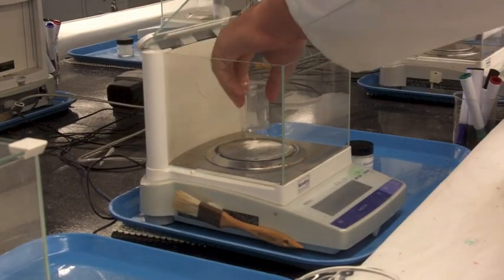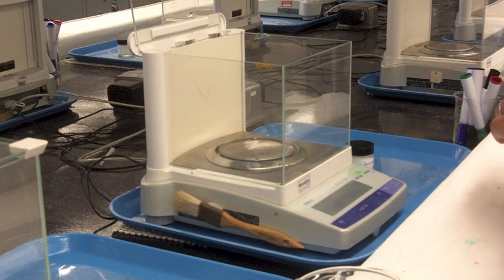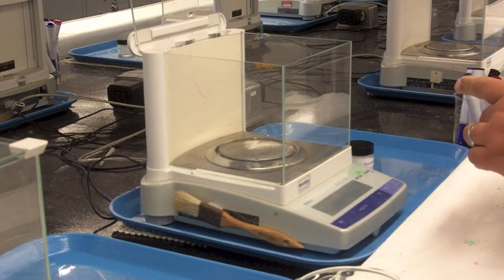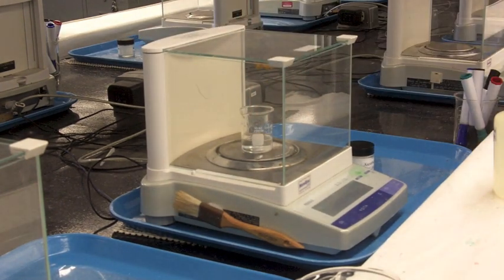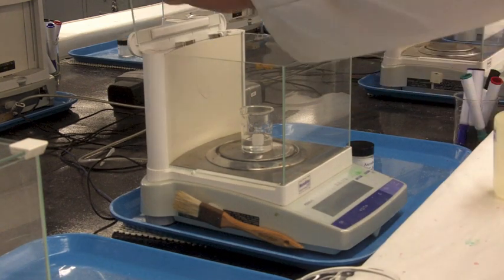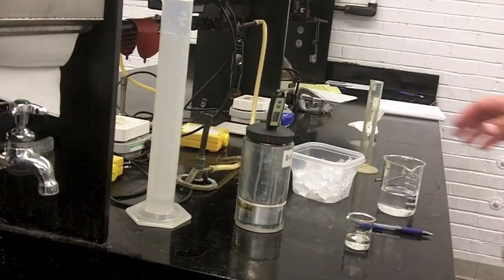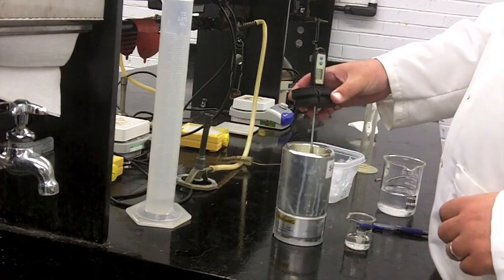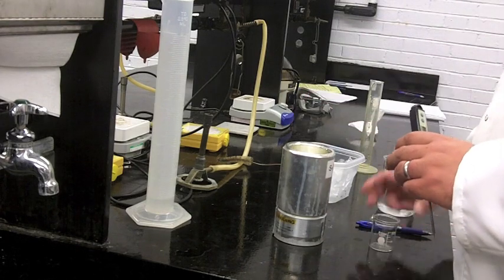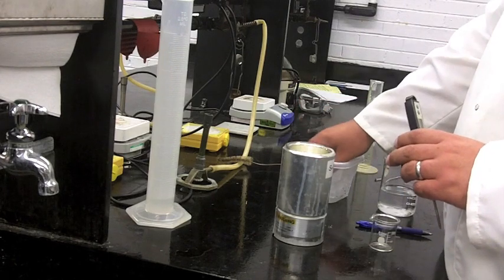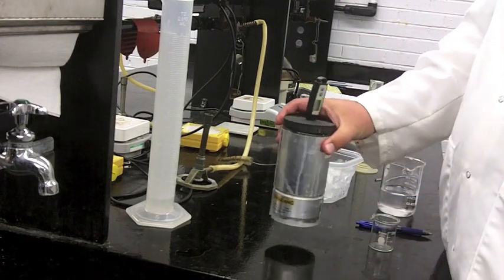Now you'll measure out a certain mass of solute. You'll have two alcohols to choose from—pick one of them and do that. Make sure you get the mass of it, not just the volume. You don't even really need the volume; you really just need mass. But it should be about 10 mLs—10 mLs is usually enough to get you in the ballpark. Once you measure that and you've got this equilibrated system, you can go back, dump that into the dewar. You'll probably need to chuck in a little bit more ice because the ice is going to melt, and then repeat basically the swirl and the rest of it.